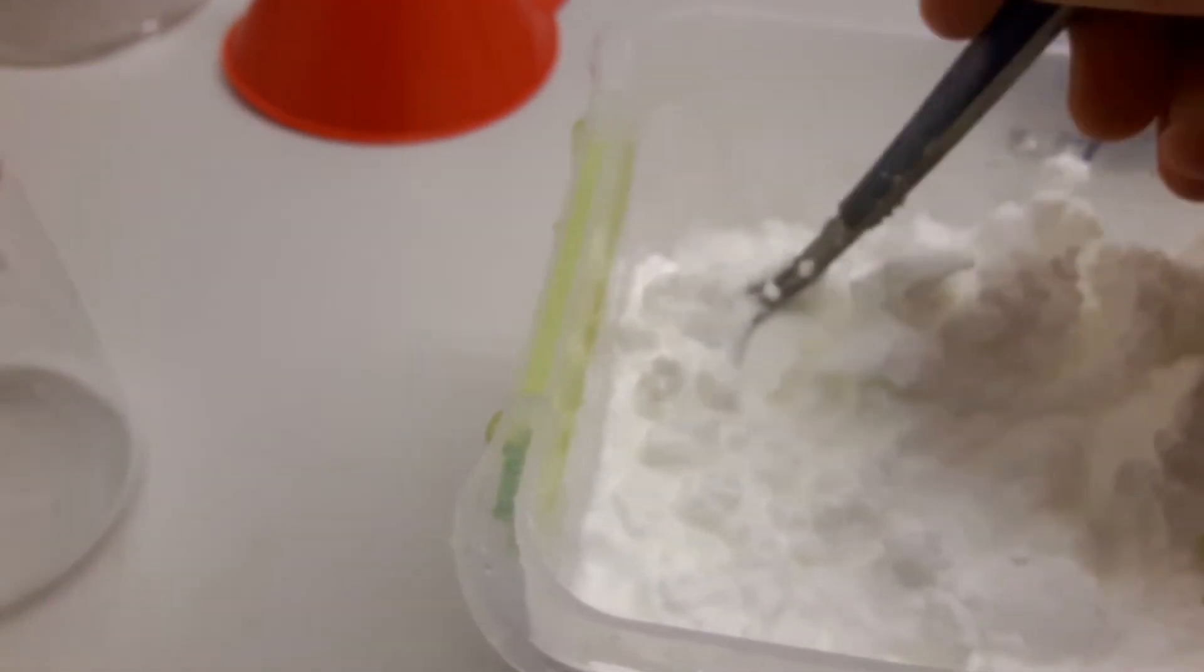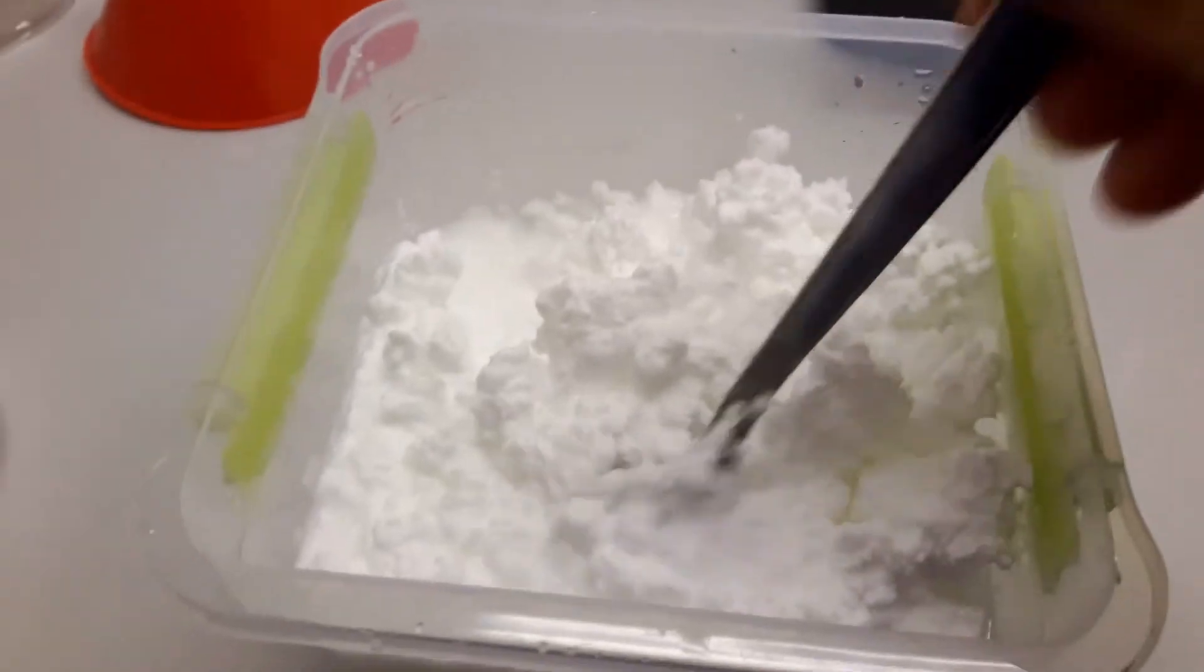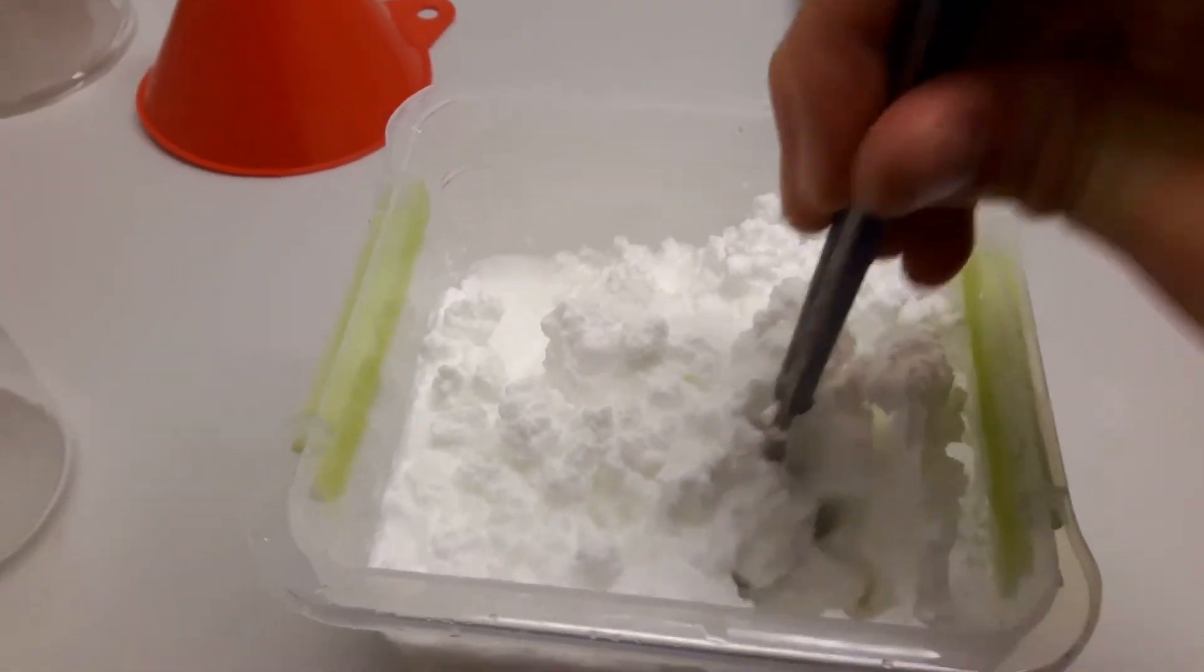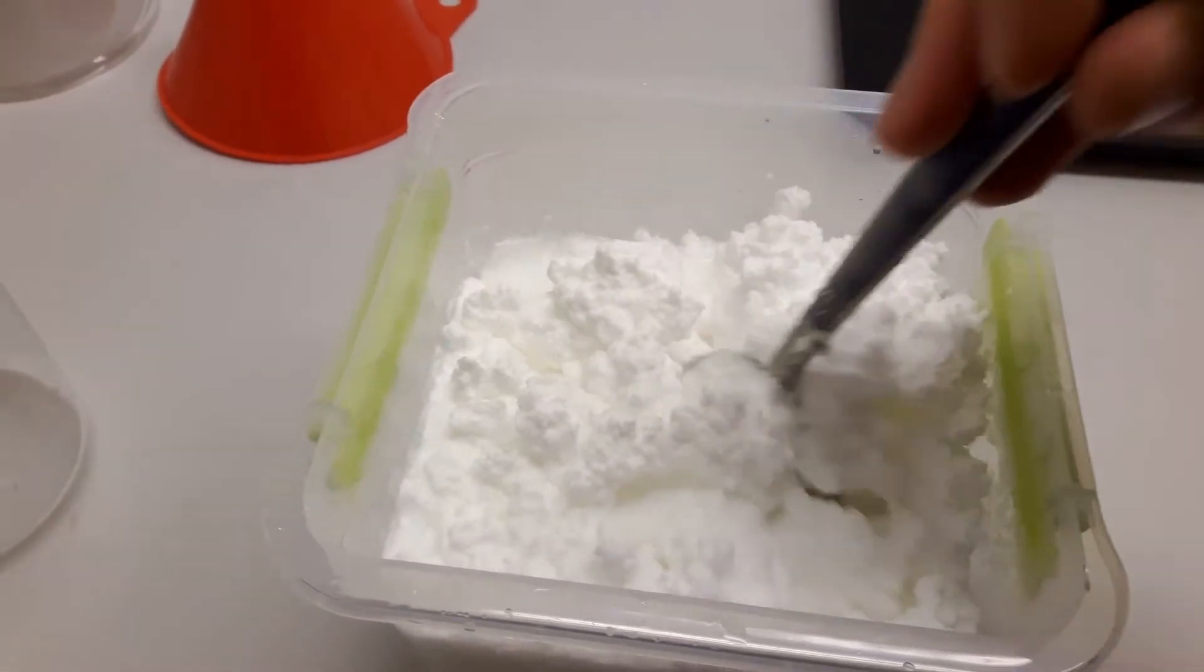I did not know how benzoic acid smelled, and it does not smell well. This is now a mixture of sodium sulfate, benzoic acid, water, and probably some sulfuric acid.